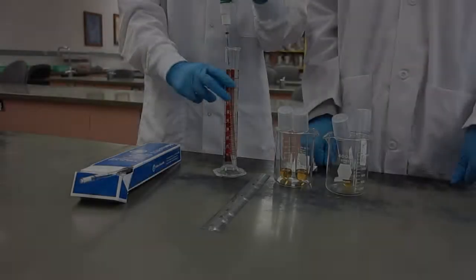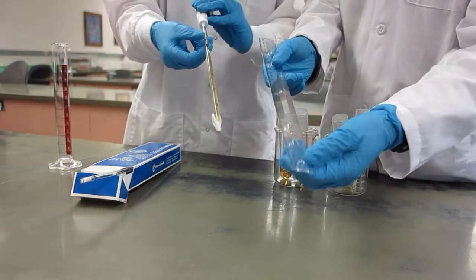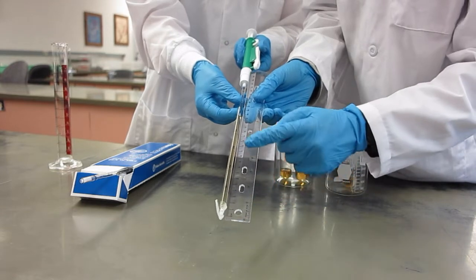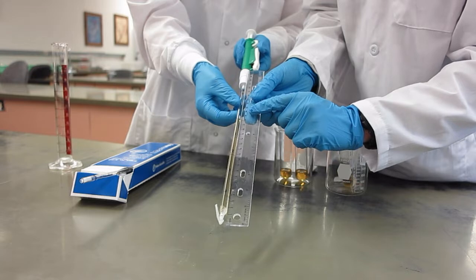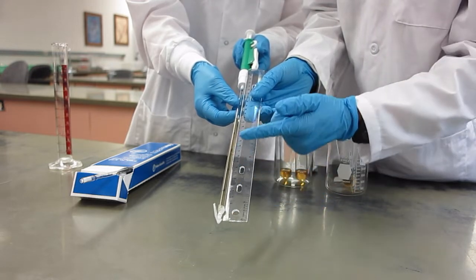After the 10 minutes is up, obtain a ruler. Starting at the bottom of the glass pipette, measure the length of the total volume of liquid in the pipette in millimeters. Also, starting at the bottom of the glass pipette, measure the height of the cloudy cell haze in millimeters. Record these data in Table 1.